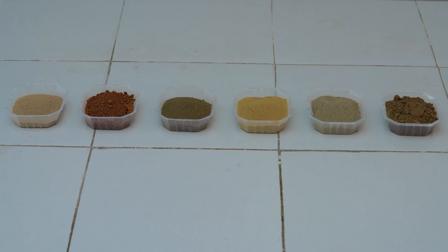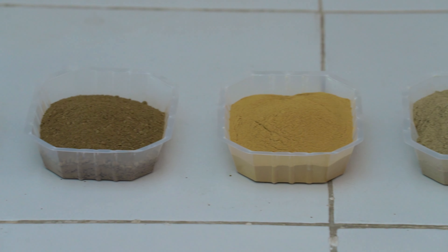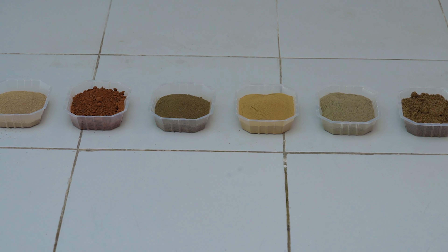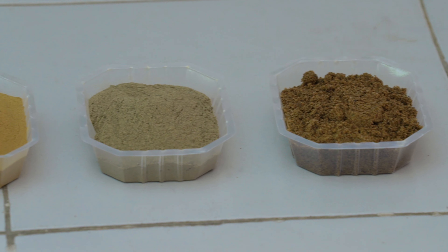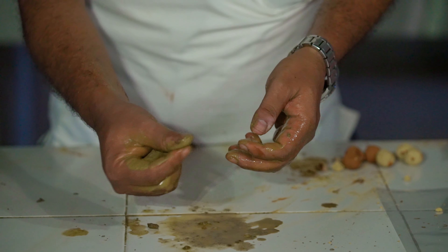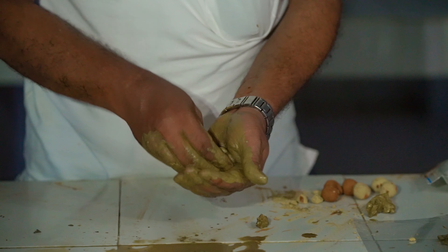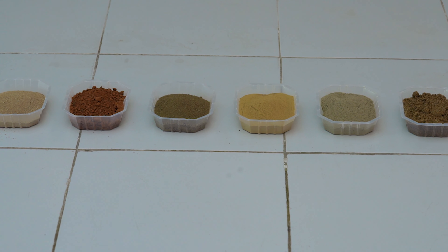Determination of soil texture by feel method. Soil texture refers to the relative proportion of sand, silt, and clay particles in a mass of soil. It is the most important physical property of soil that influences many soil properties including productivity. Soil texture can be determined in the field by feeling the soil between fingers. The method is based on the differential feeling of moist soil and is known as the feel method. Sand particles feel gritty when rubbed between fingers; silt particles feel smooth and powdery; clay particles feel smooth, sticky, and plastic when the soil is moist.